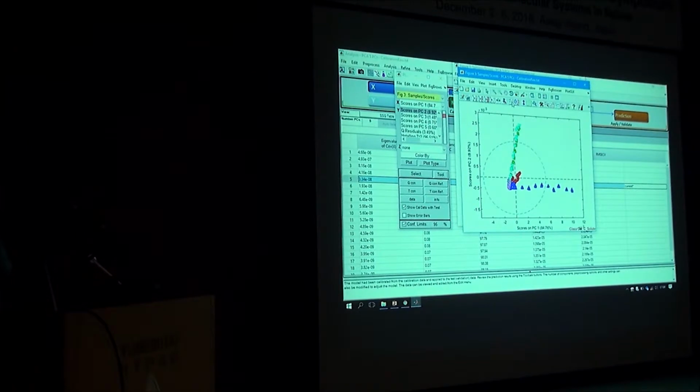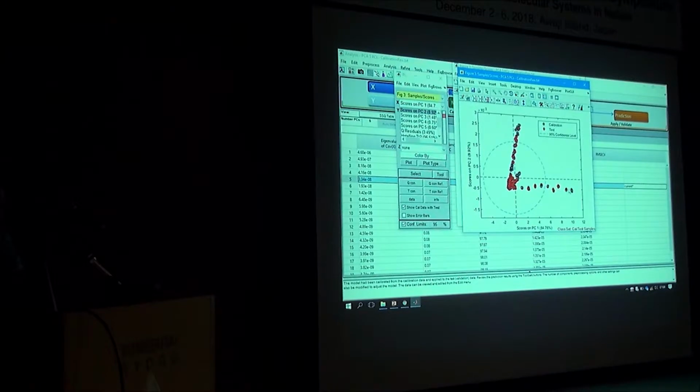And then you can color it according to test and calibration. So you have got calibration and test set, and you can see clearly there. So it's a no-brainer that you can identify some of those samples. The problem is when you get closer to 0, and that is the trick: how you can identify there.